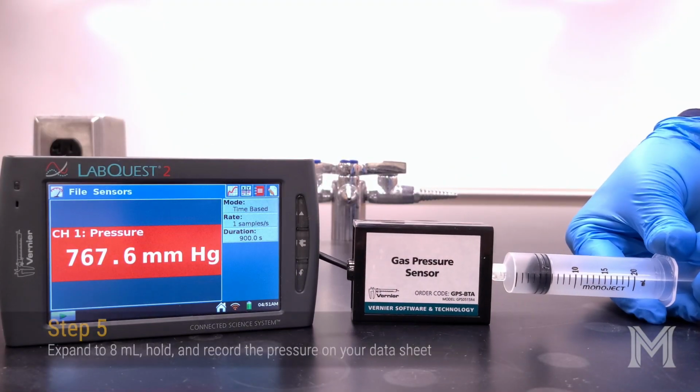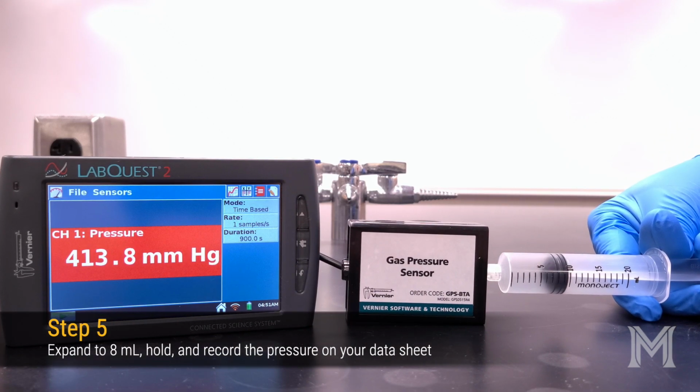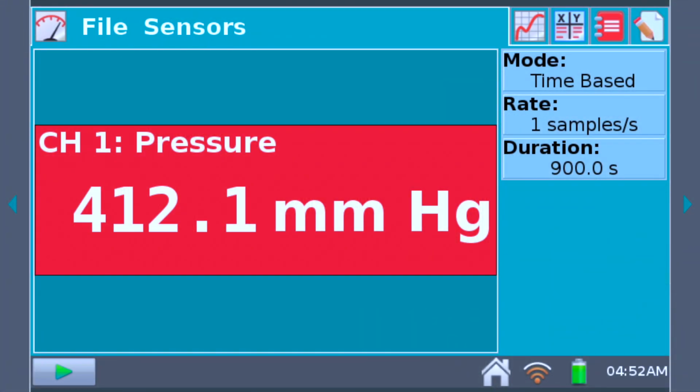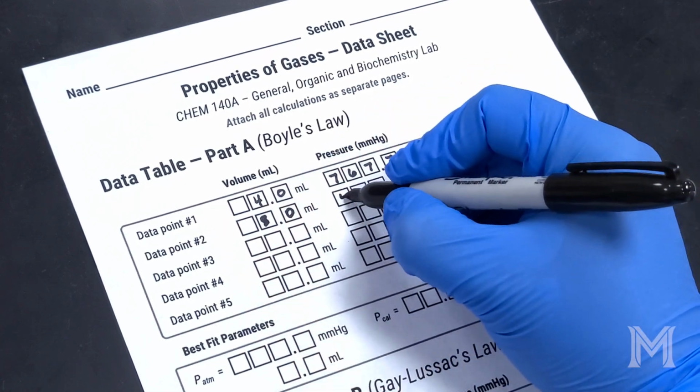While holding the back of the syringe, carefully slide the plunger out to a volume of 8 milliliters, making sure that the leading edge of the plunger lines up with the 8 milliliter marking on the side of the syringe. While holding the syringe as steady as possible, wait for the pressure to stabilize and then record the value on your data sheet.